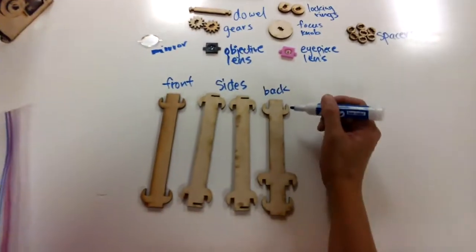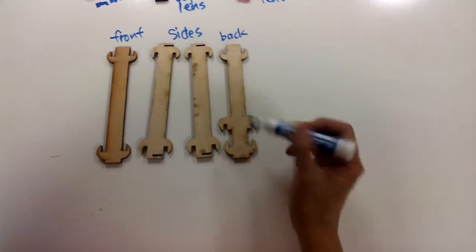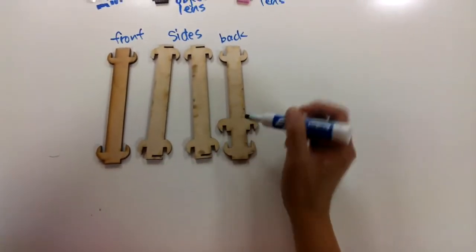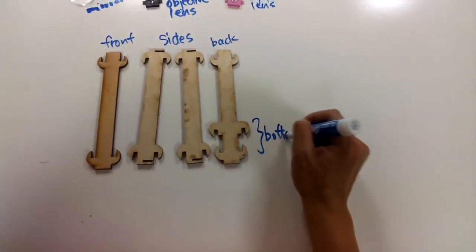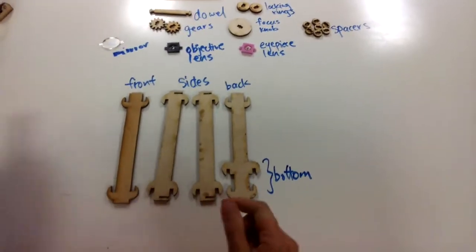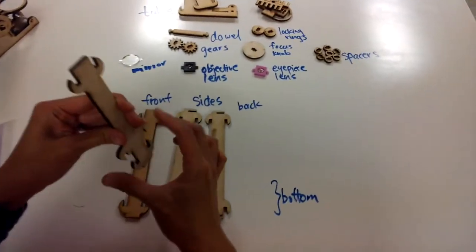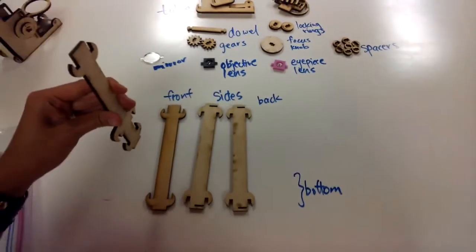We're going to start with the back piece. And you'll notice on the back piece here that you've got the hooks on the top, hooks on one end, hooks on the other end, and then this extra hook. So the side that's closest to the extra hook, this is going to be the bottom of your tube. So when you're building, make sure you remember which side is the bottom. So in my case, when I pick up this piece, I'm going to keep pointing this side that has the 2 sets of hooks closer together, that side on the bottom.